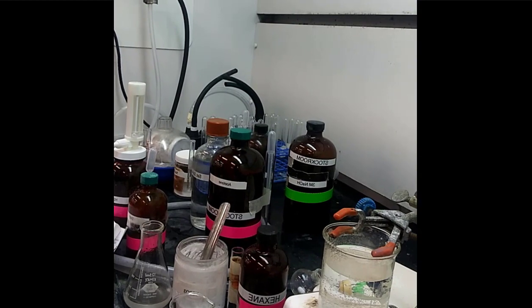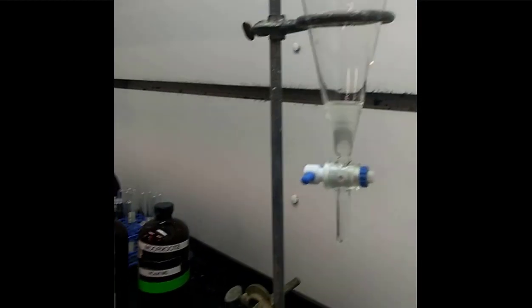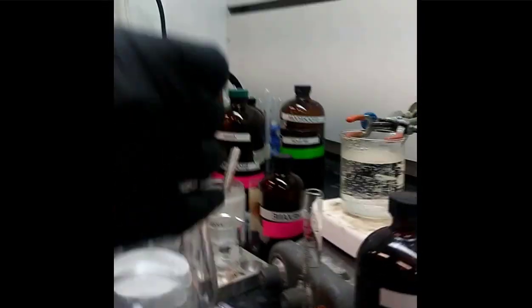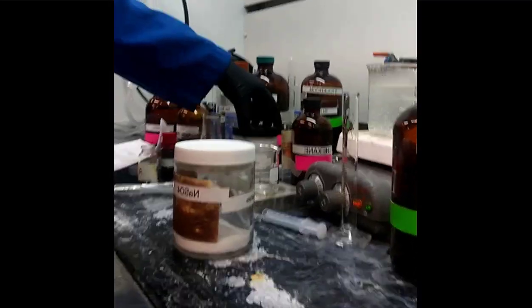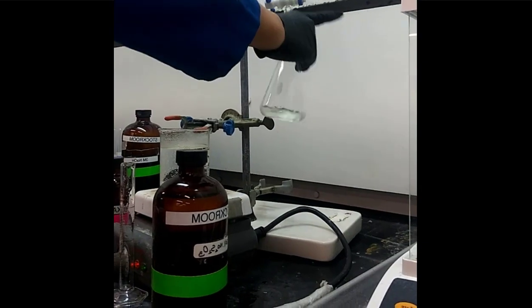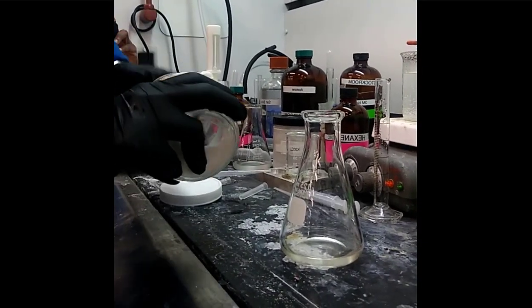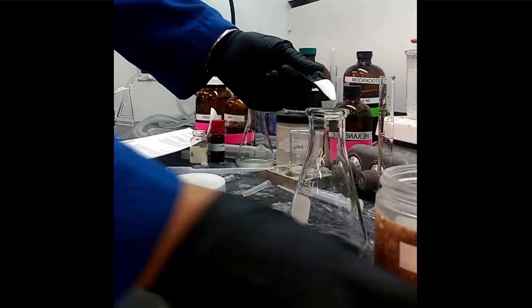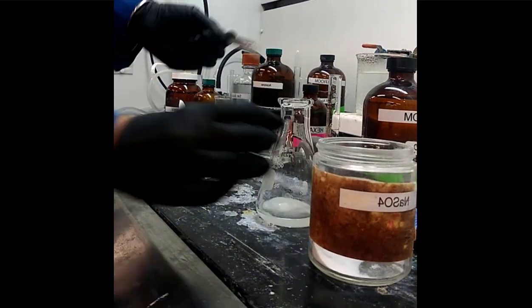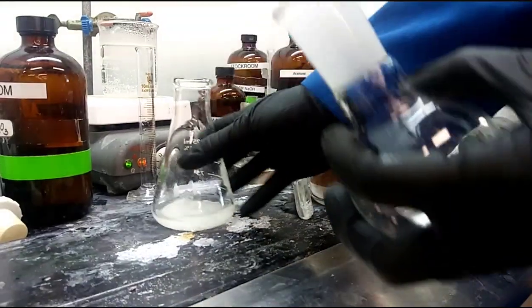All right, and then as one last precautionary measure, you could still have some water in the organic layer. So as a means to remove that water, they're going to use an anhydrous solid, sodium sulfate, which is very hygroscopic, so it's going to absorb water quite readily. They're going to put it in the Erlenmeyer flask that has the organic phase, shake it a little bit, and let it sit for about 15 minutes to absorb all that water.